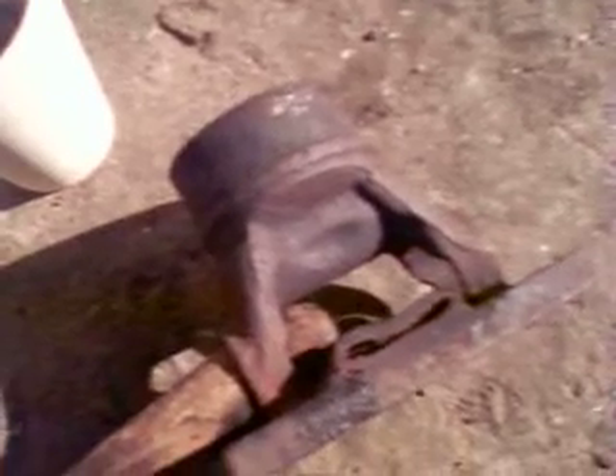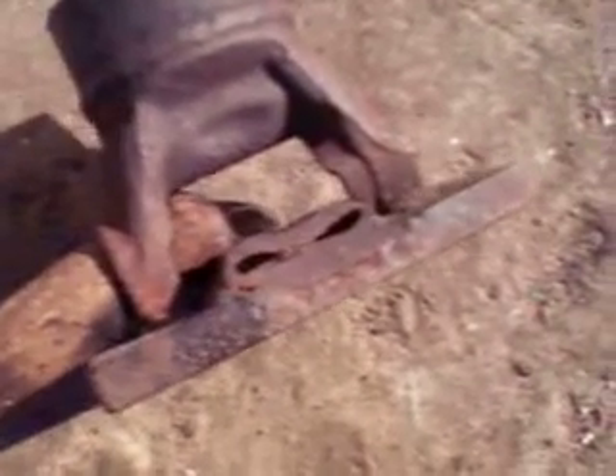I guess that is something else I can show you. This here is my mold — made out of the end of the drive line from a vehicle. Took that, welded it to this plate right here where the U-joint attaches, took a small piece of wooden dowel, drove it in — U-joint yoke. It is all tapered on the inside. It worked pretty well actually for producing the bead — not bead, but ingot I guess you can call it. It is called a prill on a fire assay, but it works well for that.